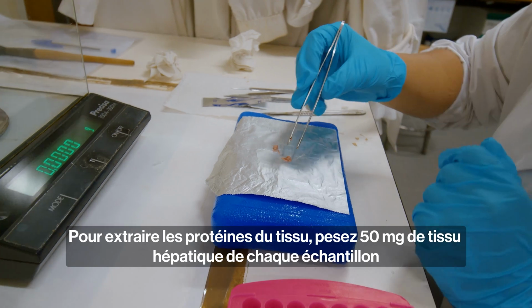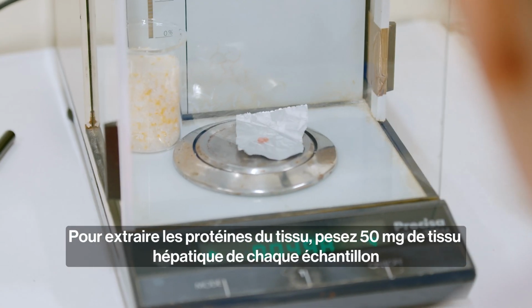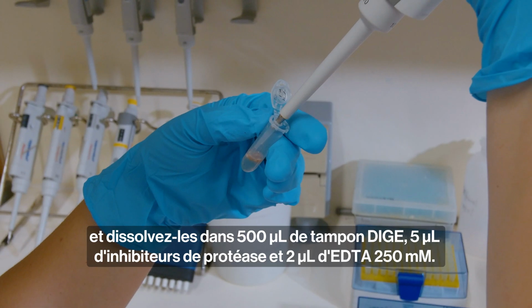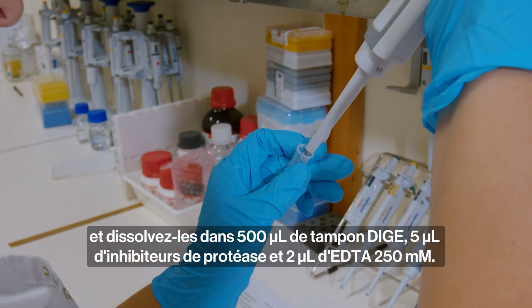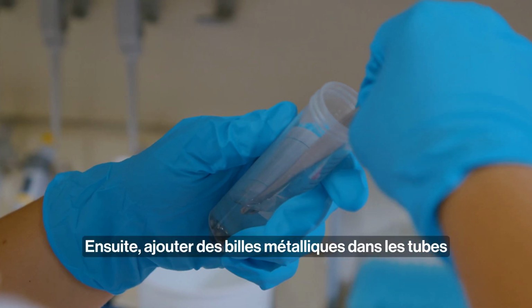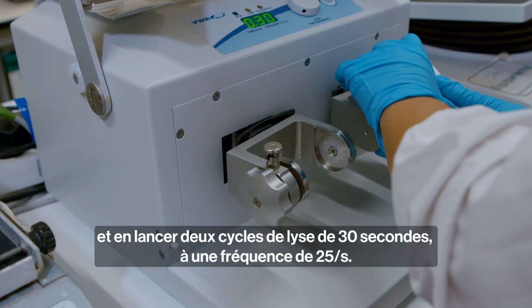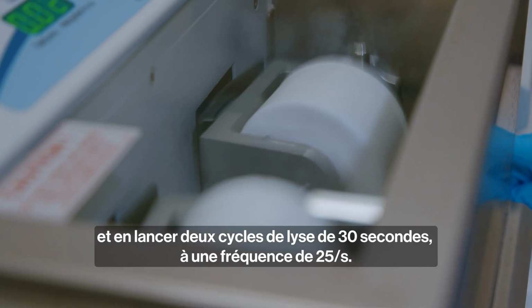To extract the protein from the tissue, weigh 50 mg of liver tissue from each sample and dissolve it in 500 microliters of DIGE buffer, 5 microliters of protease inhibitor cocktail, and 2 microliters of EDTA 250 millimolar. After, add metal beads to the tubes and homogenize the samples with a tissue lyser for 2 cycles of 30 seconds at a frequency of 25 per second.